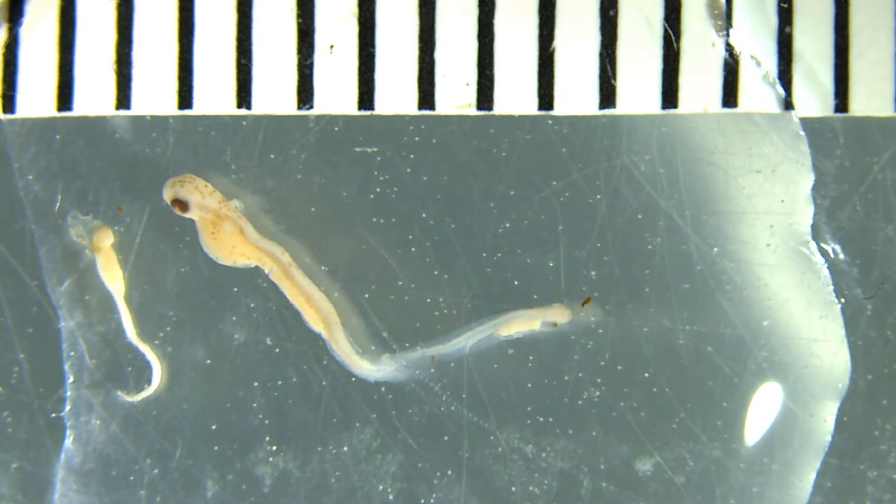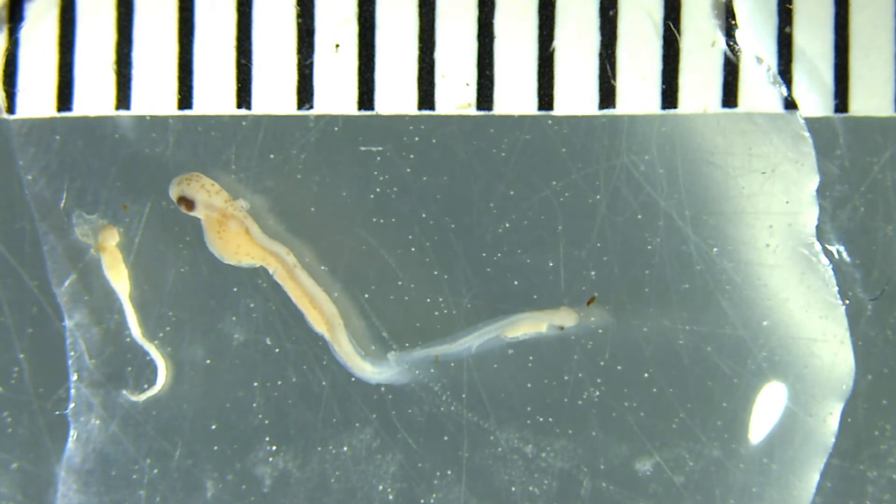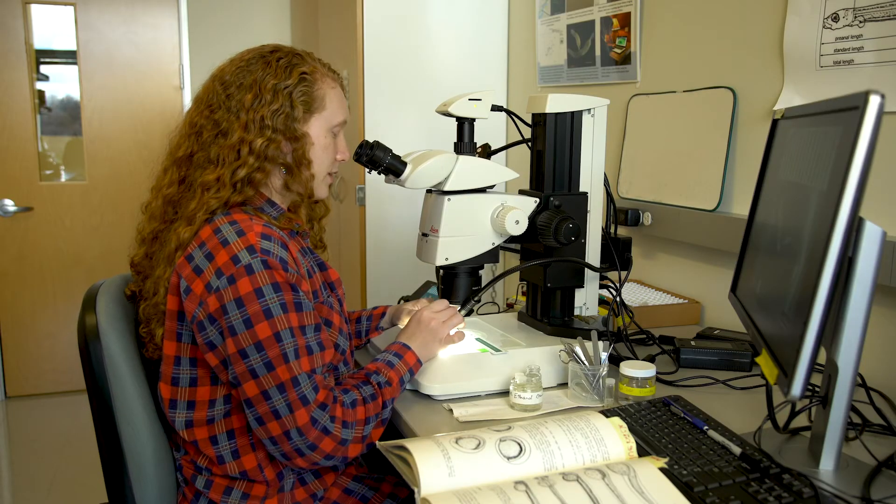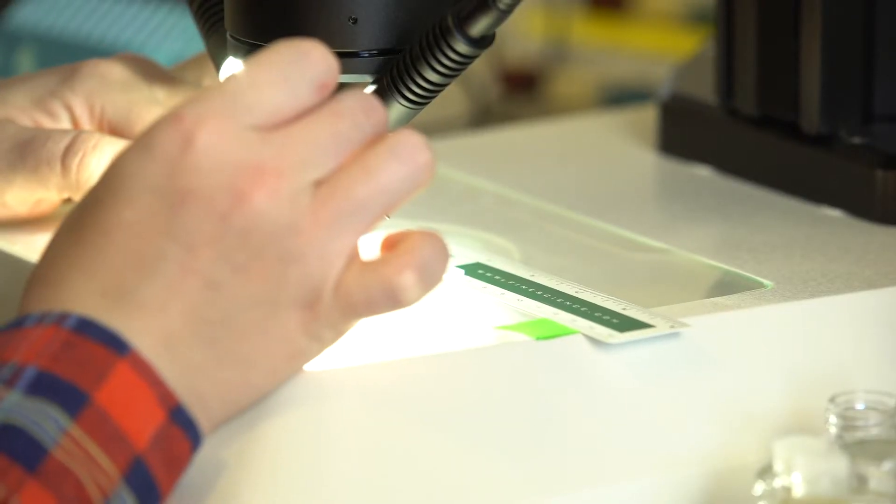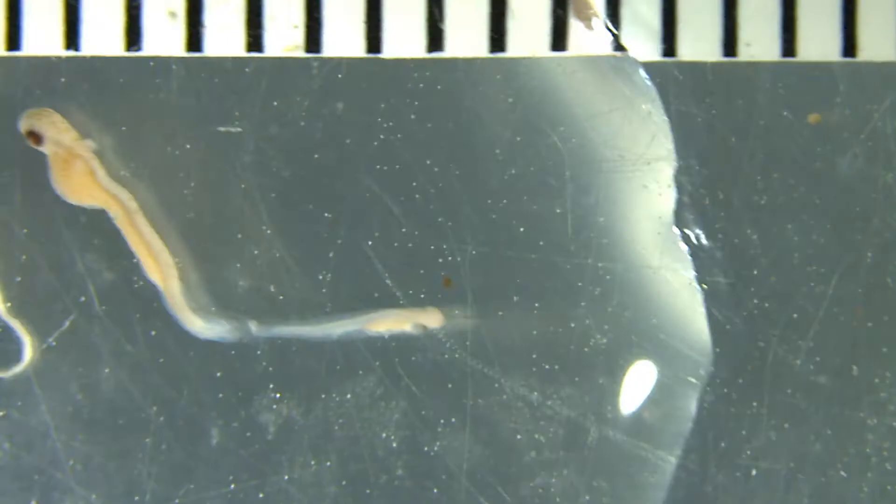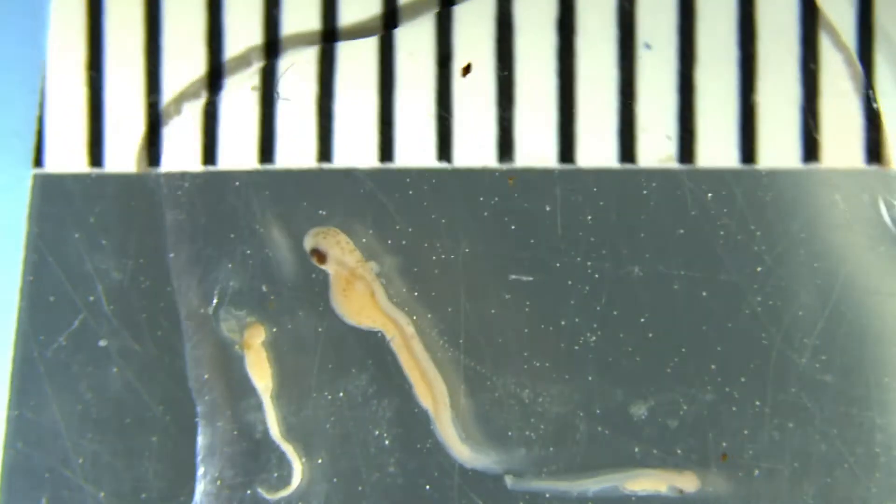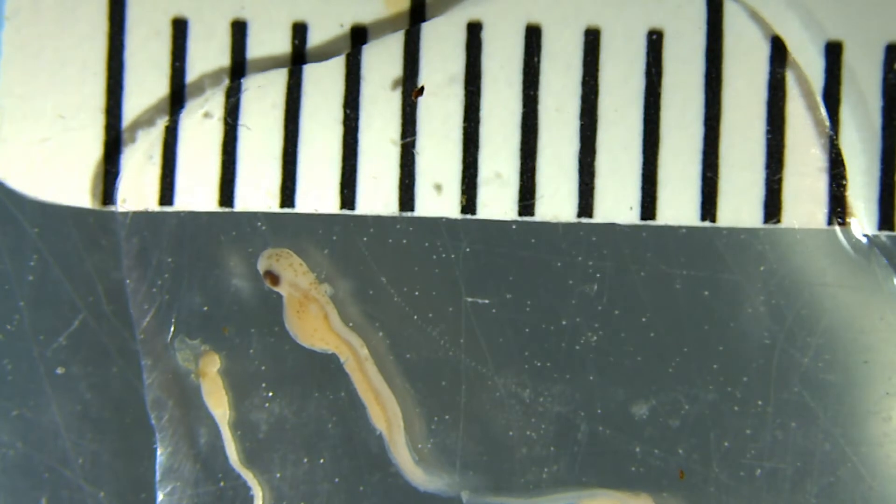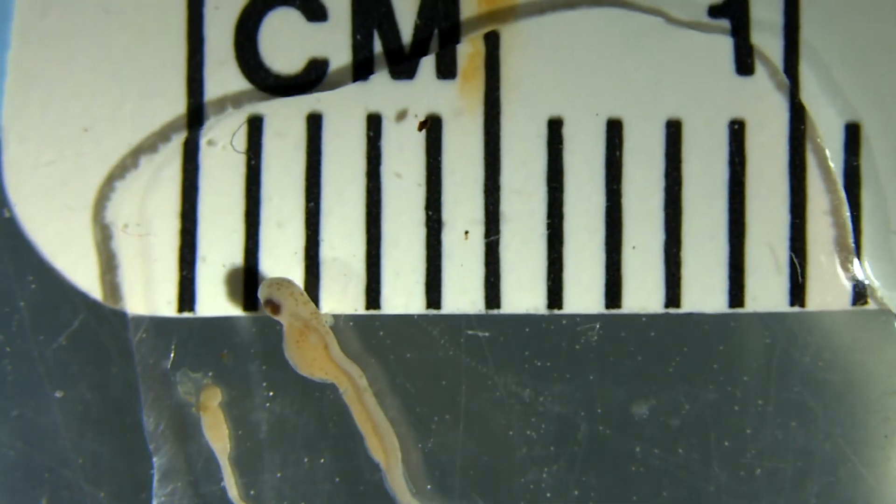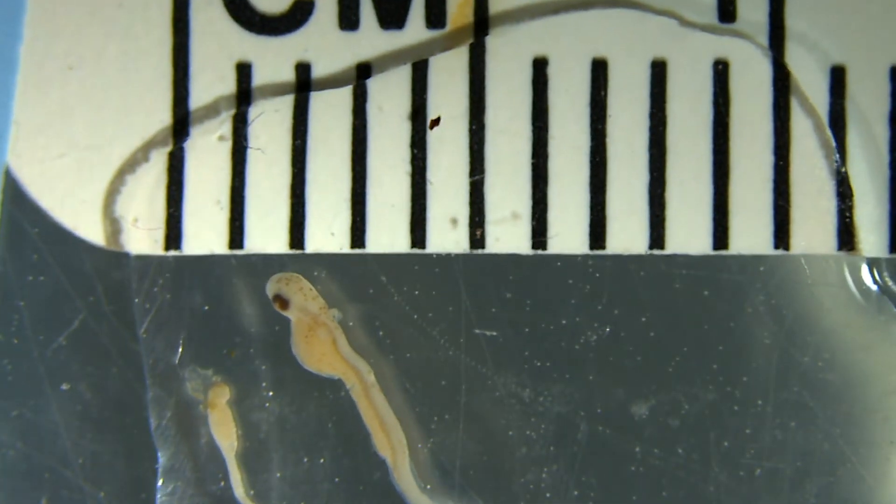I've pulled four larvae for you guys today. All these are pre-identified. I know what they are but I think they represent all the four different characteristics that we really look for in the fish. So here's three of our smaller ones and you can really see how small they are because I have a ruler right here. Each distance between the two bars, that's one millimeter.